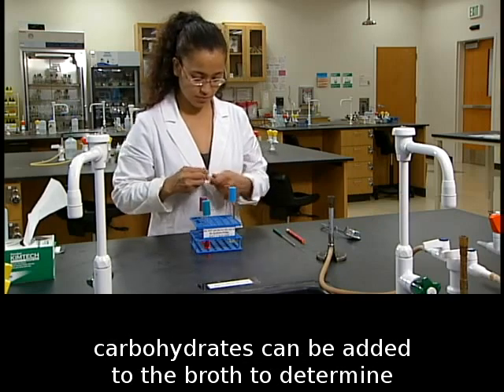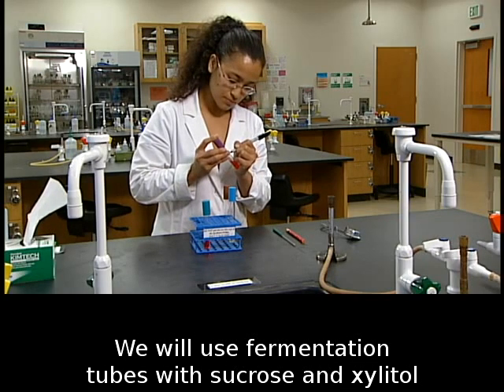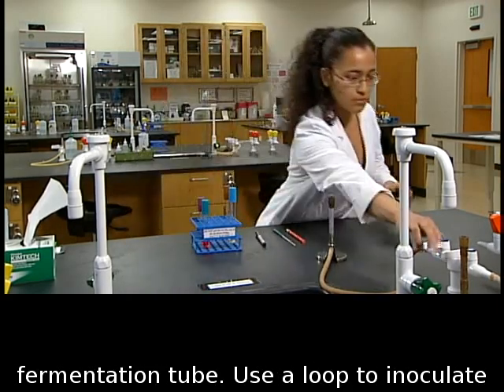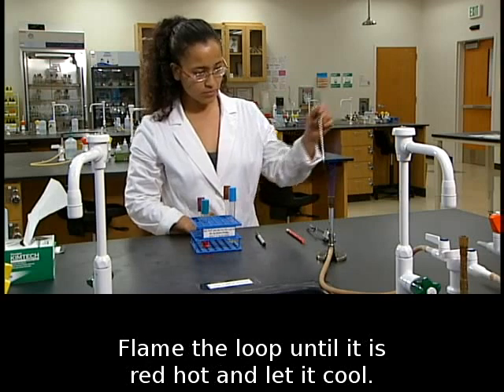Different fermentable carbohydrates can be added to the broth to determine the fermentation reactions of a bacterial species. We will use fermentation tubes with sucrose and xylitol for the sources of carbohydrate. Label each fermentation tube. Use a loop to inoculate fermentation tubes with the bacterium to be tested.